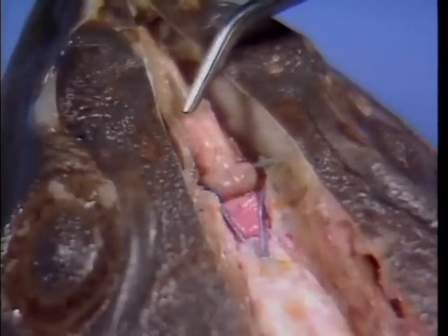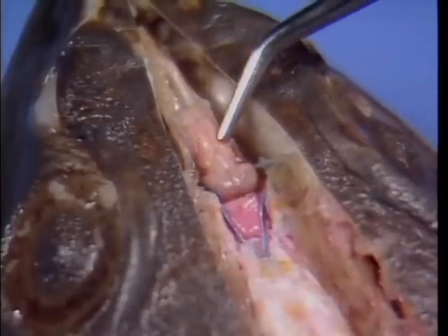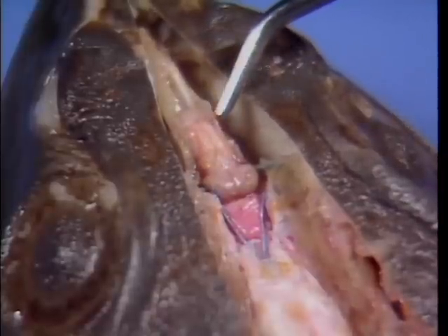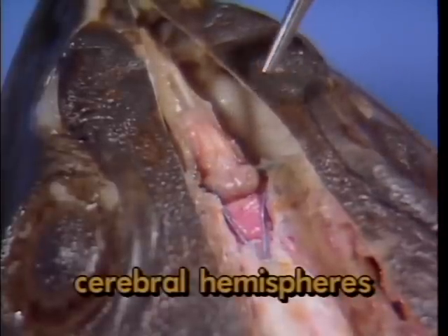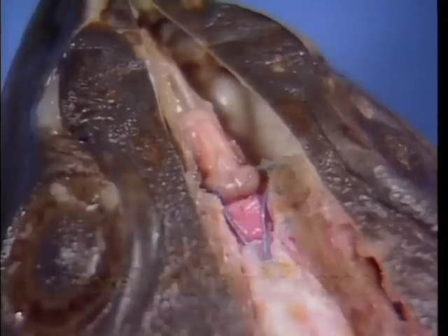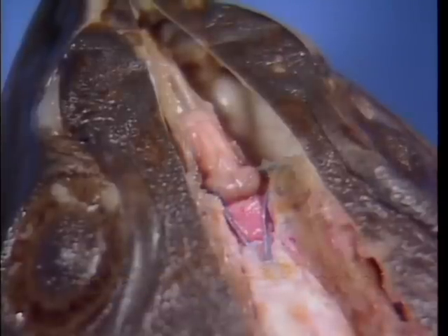Located posterior to the olfactory lobes are larger paired swellings, here and here, which represent the cerebral hemispheres. They receive sensory information from other parts of the body and correlate the information in preparation for response.